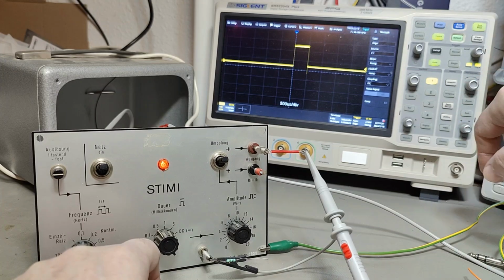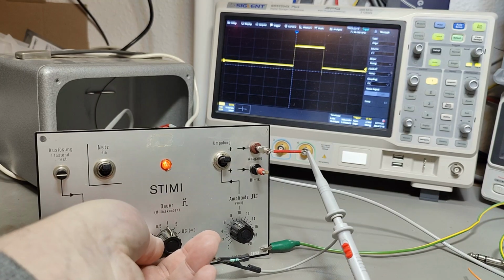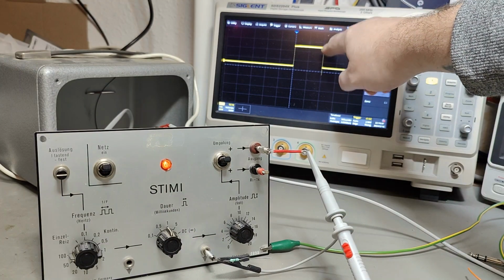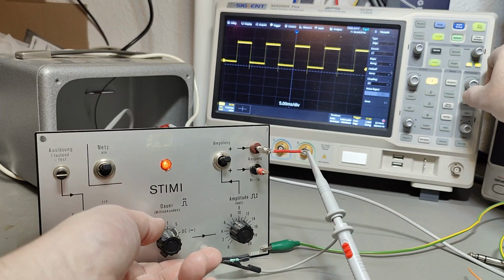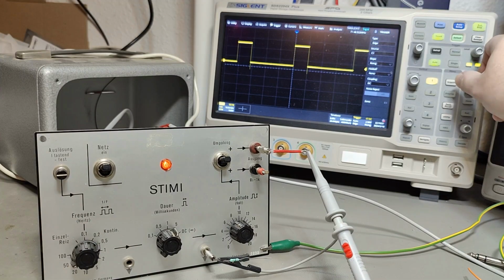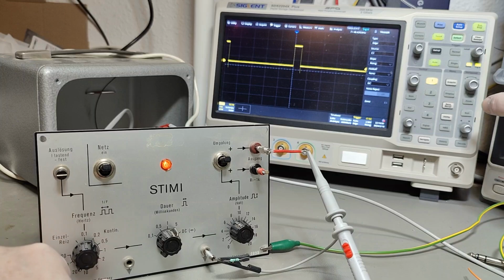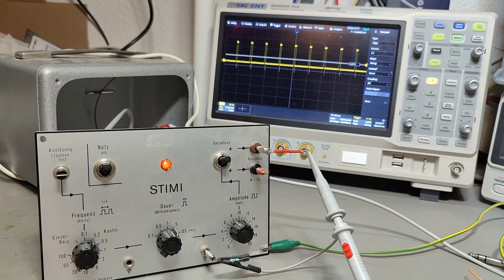I mean, exactly. Okay, 5. Let's see. Yes, 500. I mean, look at that. Wow. How is that possible? 1 millisecond is just a tiny, tiny, tiny bit. 5 milliseconds. And yeah, I mean, really? And this one is supposed to be 100 hertz, and it is 96. So the next one is 50, and then it's 48. Okay, and this one is 20, and I read 18. I mean, this is just amazing.